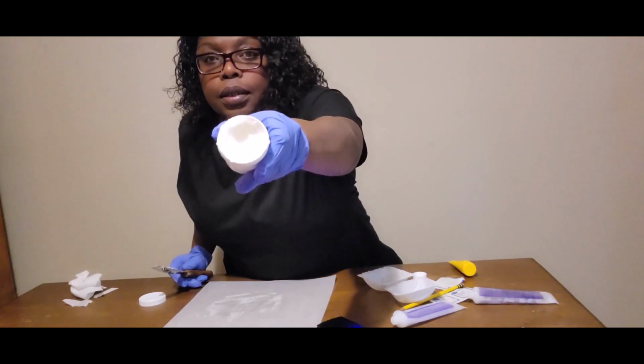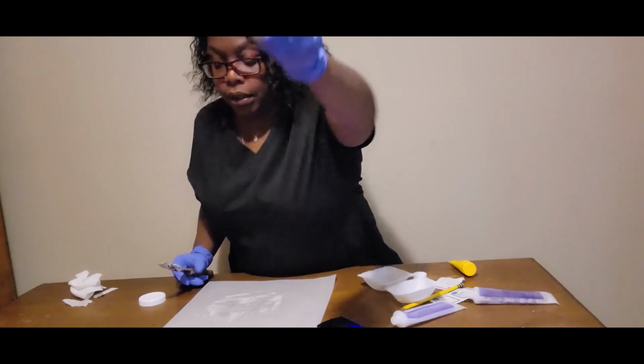Okay, that's the consistency I get, and it's in the bottle.